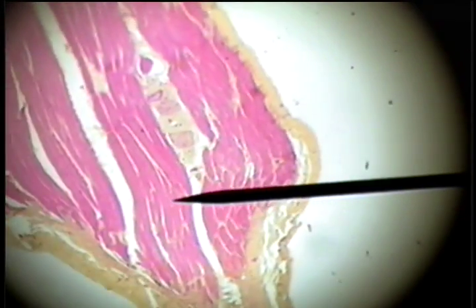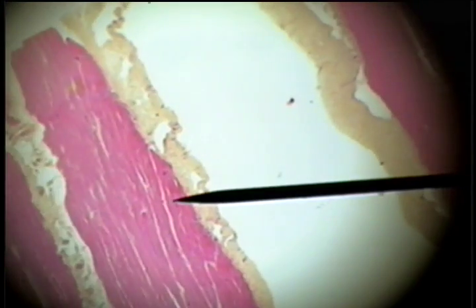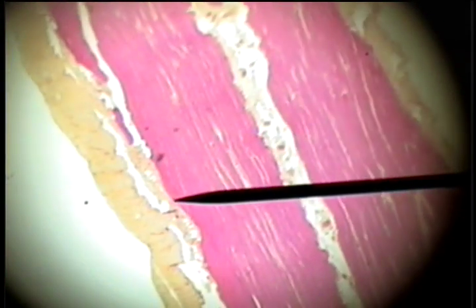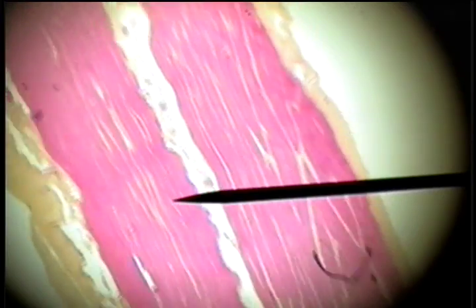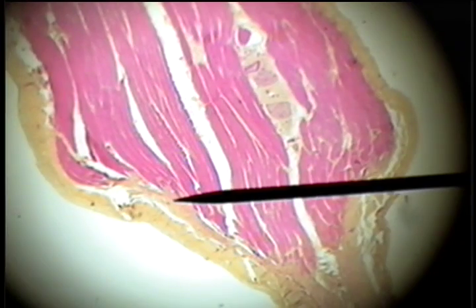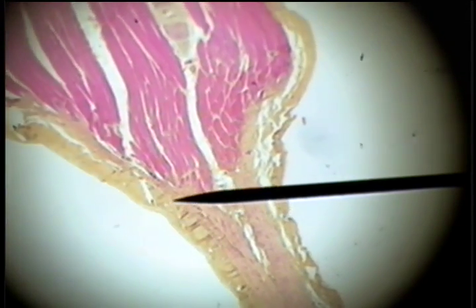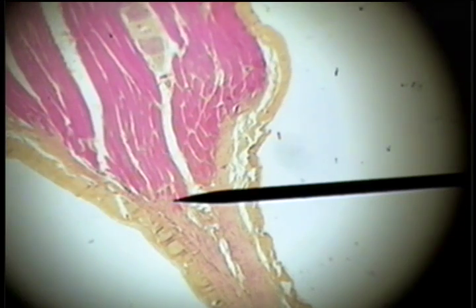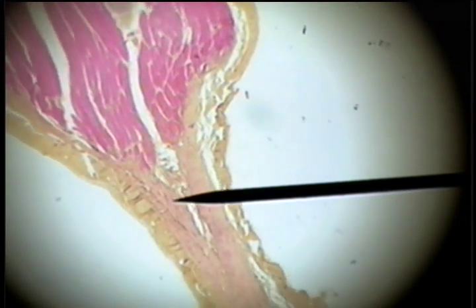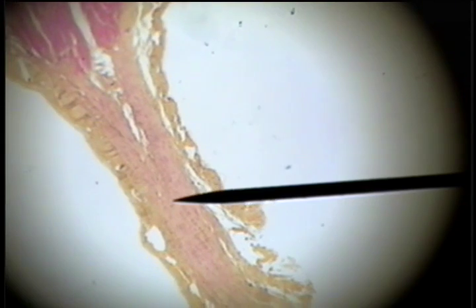This tendon attaches the muscle, and this structure here is a muscle. This is muscle tissue shown in the eosinophilic or pink, and the outer covering of the muscle here and here, and then the muscle tapers down to a point and here's where the tendon begins.